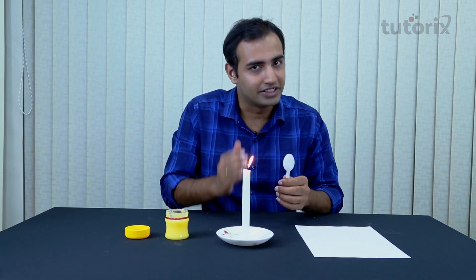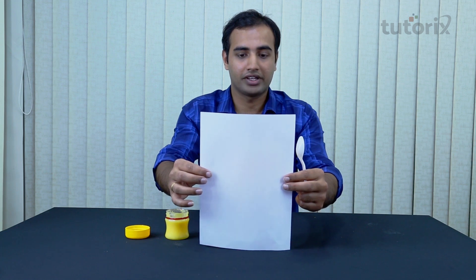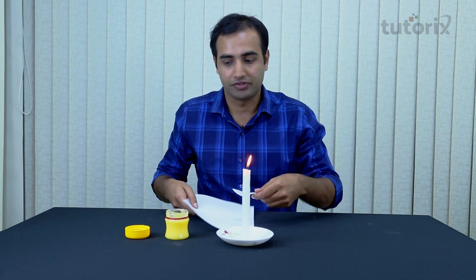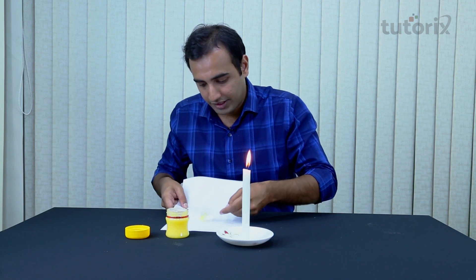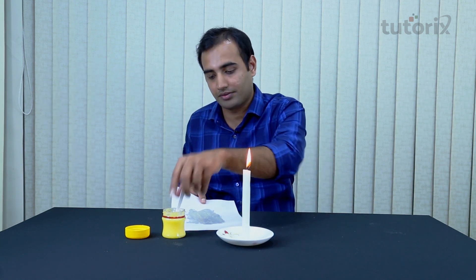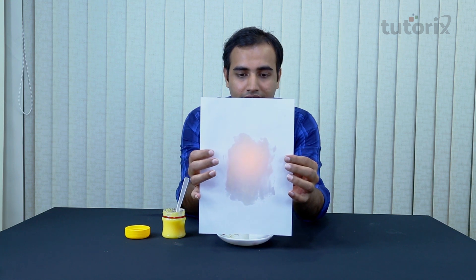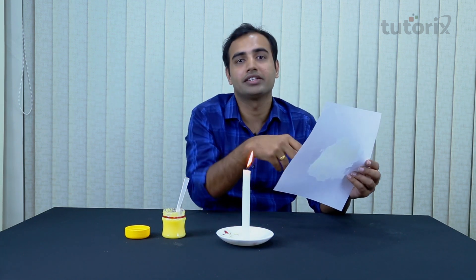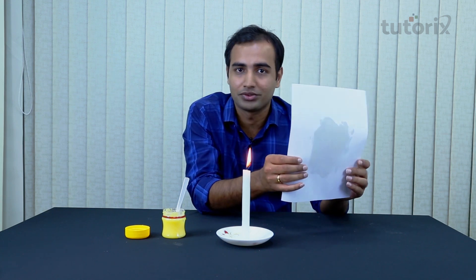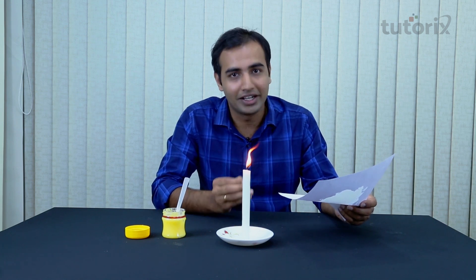Let's repeat the experiment with ghee. Here I have another paper which is currently completely blocking the light from the candle. I smear some ghee on top of it, and when I bring this paper in front of the candle, you can spot some candle light now. This paper was completely blocking the light before, but after applying the ghee it has become translucent, allowing some light to pass through — which means ghee contains abundant amounts of fats. Once again we have a positive test for fats. You can try this test with other milk products like paneer or cheese and you will get the same result.